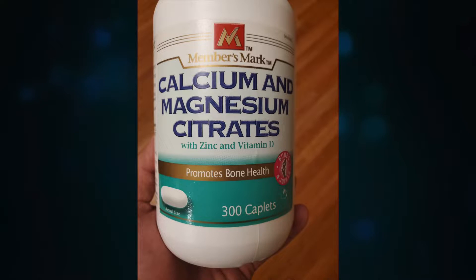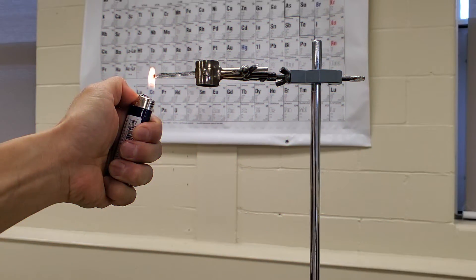What's up folks, Dennis here in my lab today. When I say the elements calcium and magnesium, you probably think of the essential micronutrients our body needs. But did you know they're actually metals? In this video I'm going to show you how reactive they are, so keep watching.